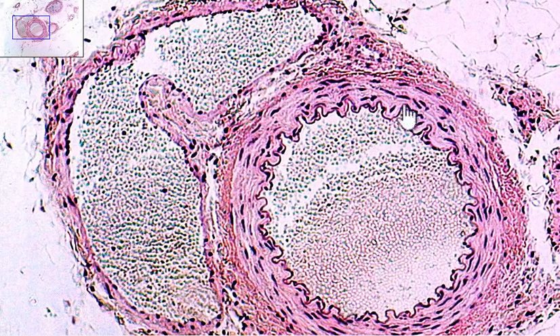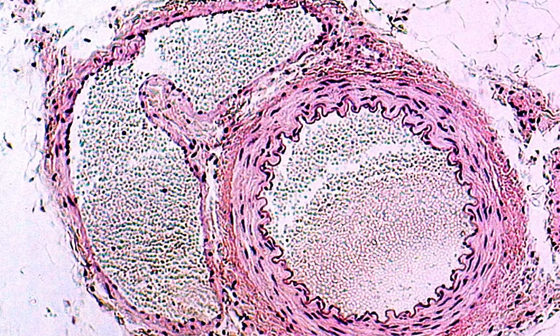In this view, we have this structure over here, which is going to be our artery, and this one over here is our vein. Now if you notice, the artery is more round, while the vein is pretty much not round. It could be almost any shape. But usually veins are a little more flattened, a little more squished. That's due to the structural components of the walls of the arteries versus the veins.